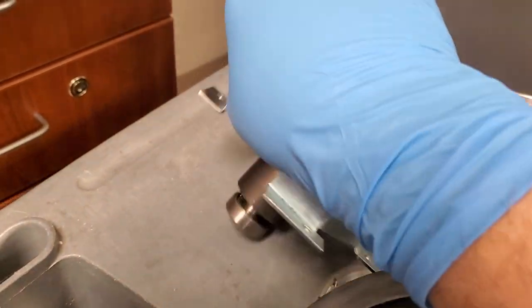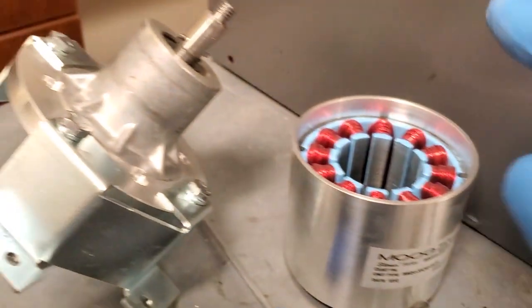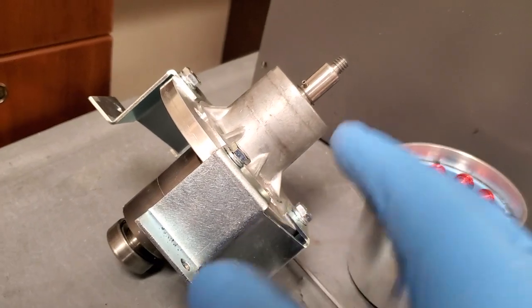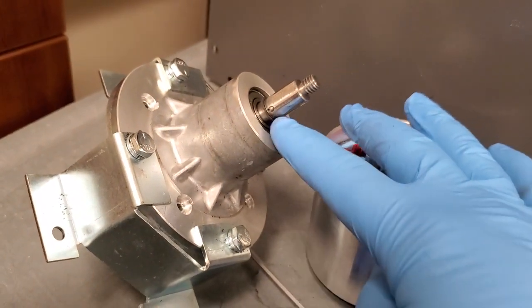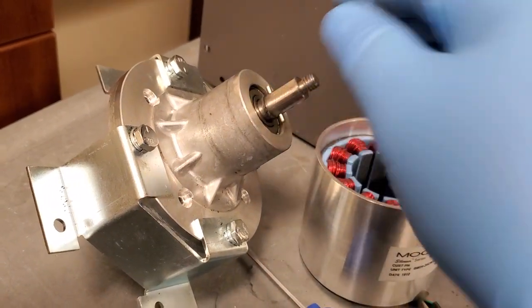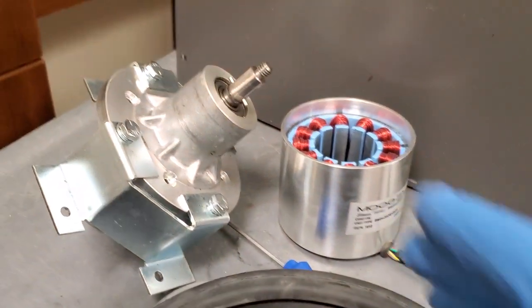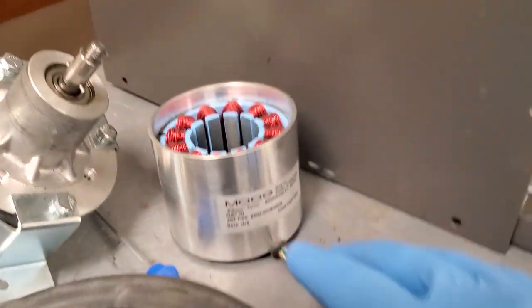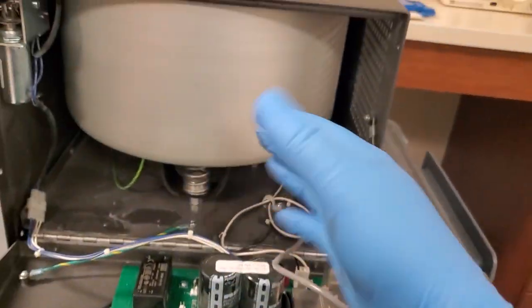And these type of motors, I do have a part number here, but the part number might not be for this exact nose cone. So that's one of the things you have to watch out for. So you might have to go with OEM because it might have this little pin drilled through. Who's to say? But this part number right here does not correlate with what the OEM part number is. There's lots of reasons for that. But anyway, it's always best to start with the OEM and see how much it is, in which case, this is what, an $800 or $900 motor to get this guy back up and going.